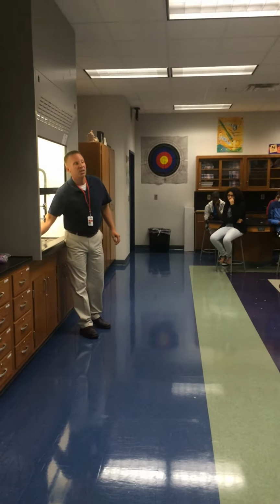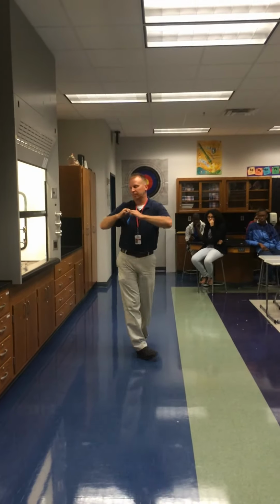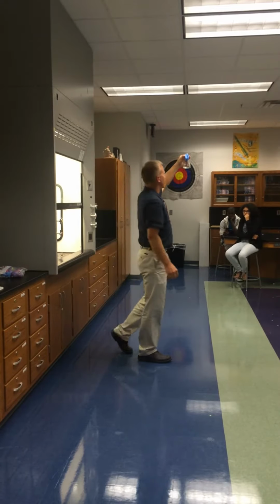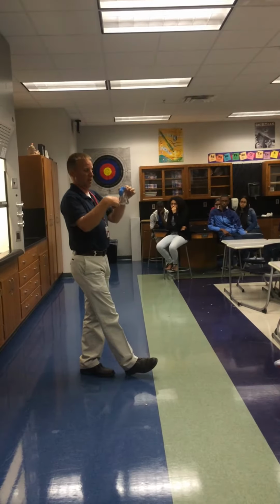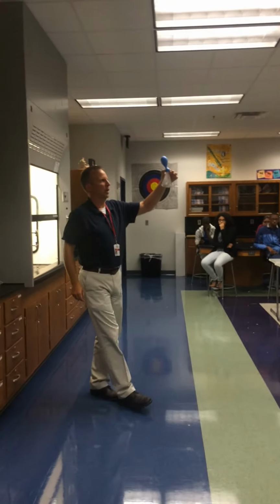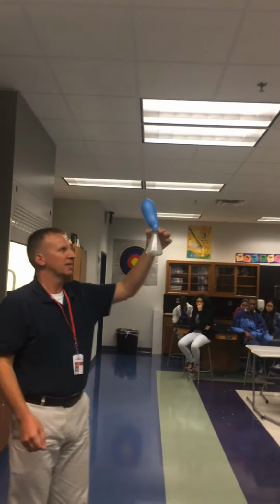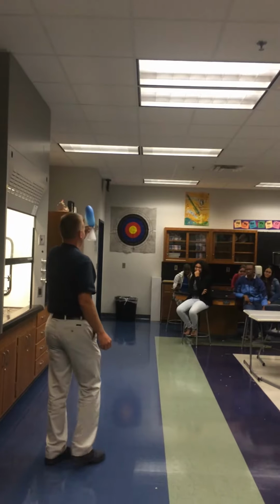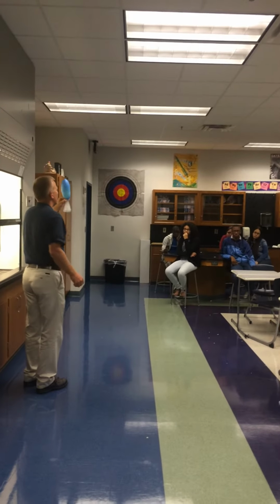Then, what we're going to do is we're going to take the balloon, we're going to stretch it over the top of the lid. I know it's going to blow up. Just like this. Now, the zinc's in the balloon. We have hydrochloric acid in the flask. And we mixed them together at this point. You see that there's a gas that's produced. It's boiling at the bottom, so it's getting hot. Look at it. Whoa! The balloon's blowing up at this point. It is filling with a gas.